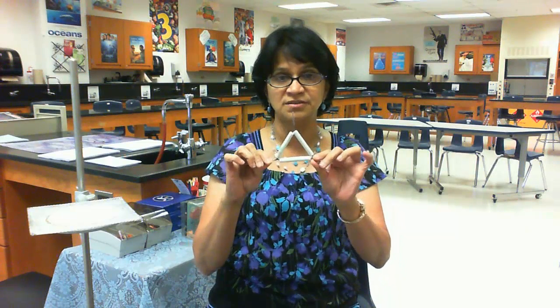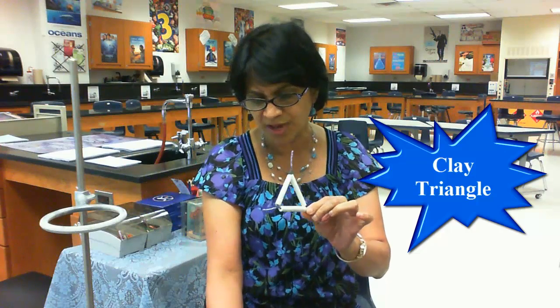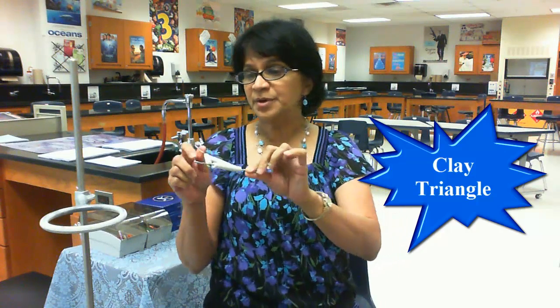The wire gauze helps the flame to spread evenly so the substance gets heated uniformly. The other thing I have to show you is the clay triangle. There are times when we have to heat some material strongly, and we can use the clay triangle as support. Both the clay triangle and the ring stand provide support to the equipment we are going to heat. That covers the basics of lab equipment and how they are used — I hope you can now identify and explain how to use each piece.